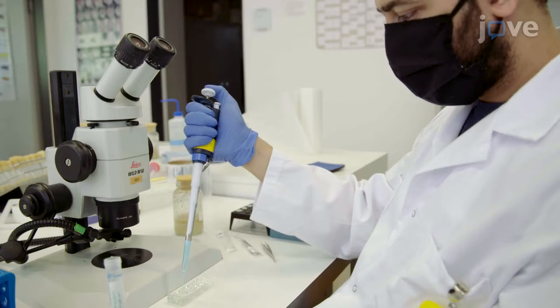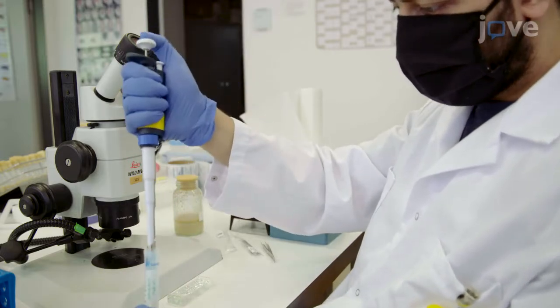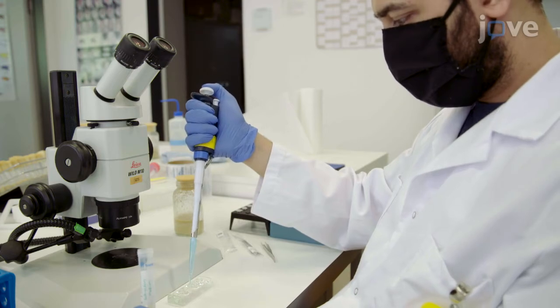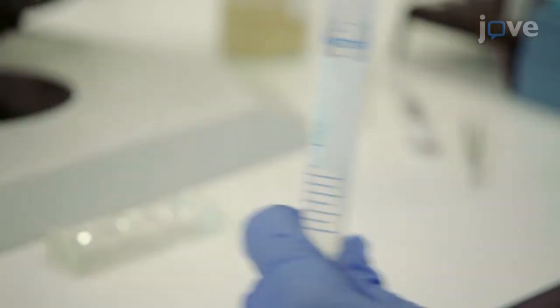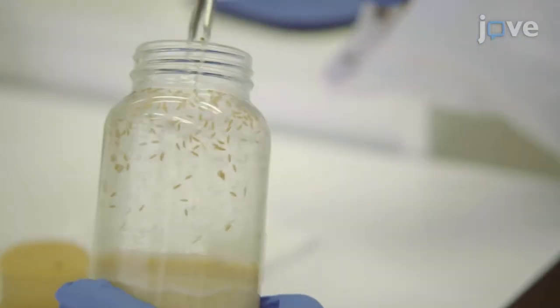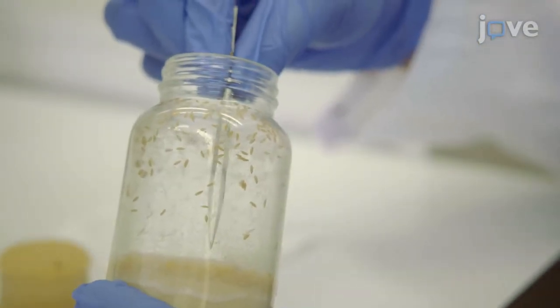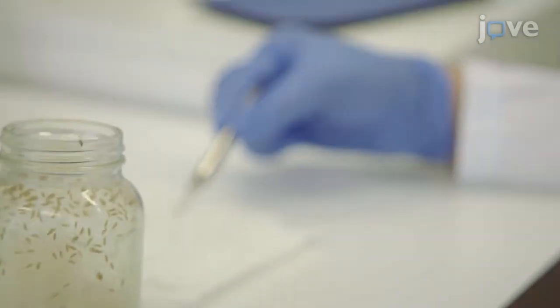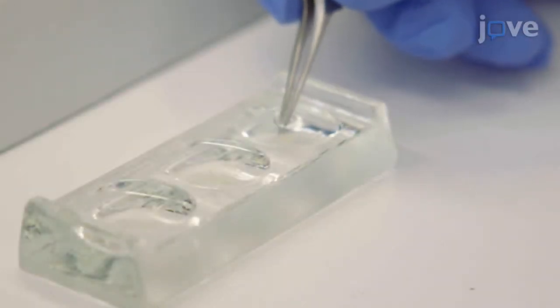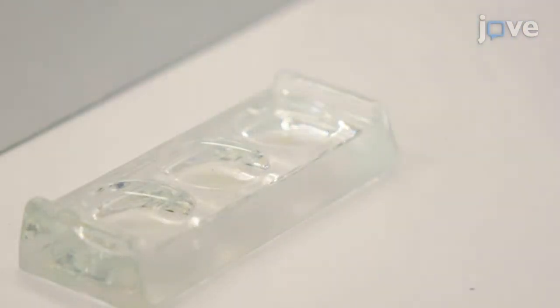To begin, add Schneider's dissection medium, or SM, to 2 consecutive depressions of a glass spot plate and add PBS to the subsequent depression. Using a pair of forceps, pick wandering third instar larvae and place them on a tissue wetted with PBS to clean off fly food residue. Place the larva in the depression with PBS, followed by the consecutive depression containing SM.